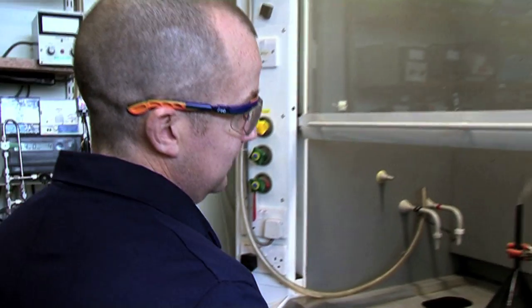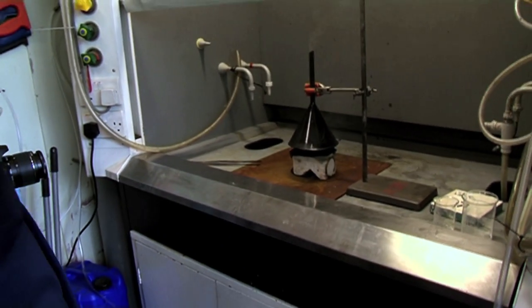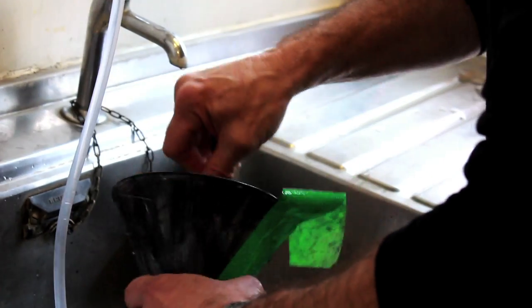We generated so much heat that we've actually cracked the chimney here. The funnel has cracked. Oh no, I think we made someone angry. I'm gonna leave before Neil gets back. Let it cool down, run a bit of water through it.